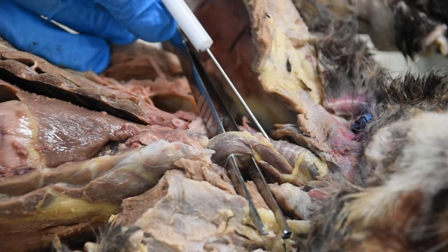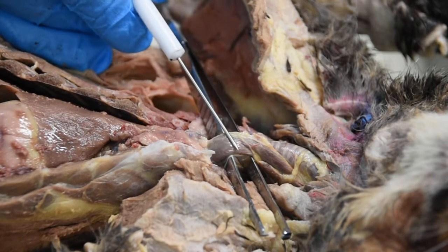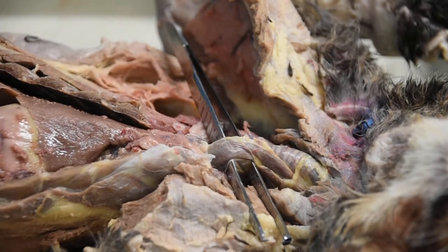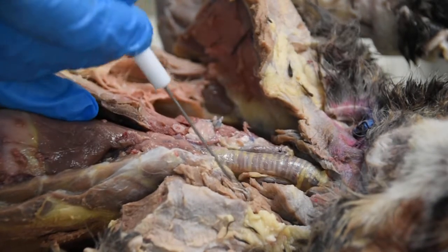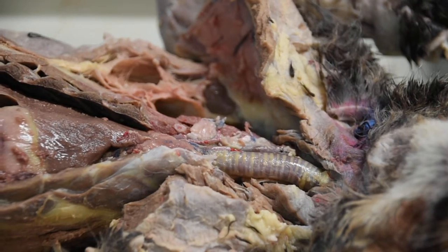The one you see underneath it, and I pulled it out to visualize it for you guys, actually sits posterior to your trachea. This is a muscular tube. You can see it is kind of collapsed right now, so it doesn't have the same opening as you see in the trachea. This tube is your esophagus, and if I remove this, you can see how it gets tucked in beneath the trachea and is not visible on the anterior view.